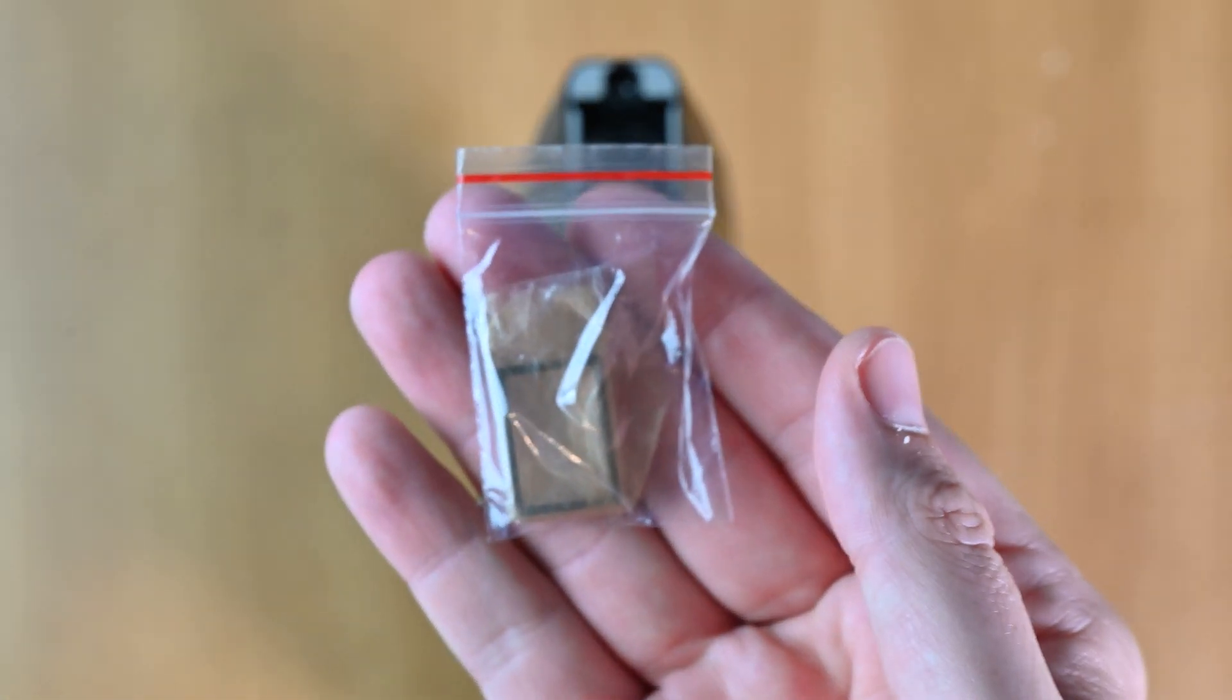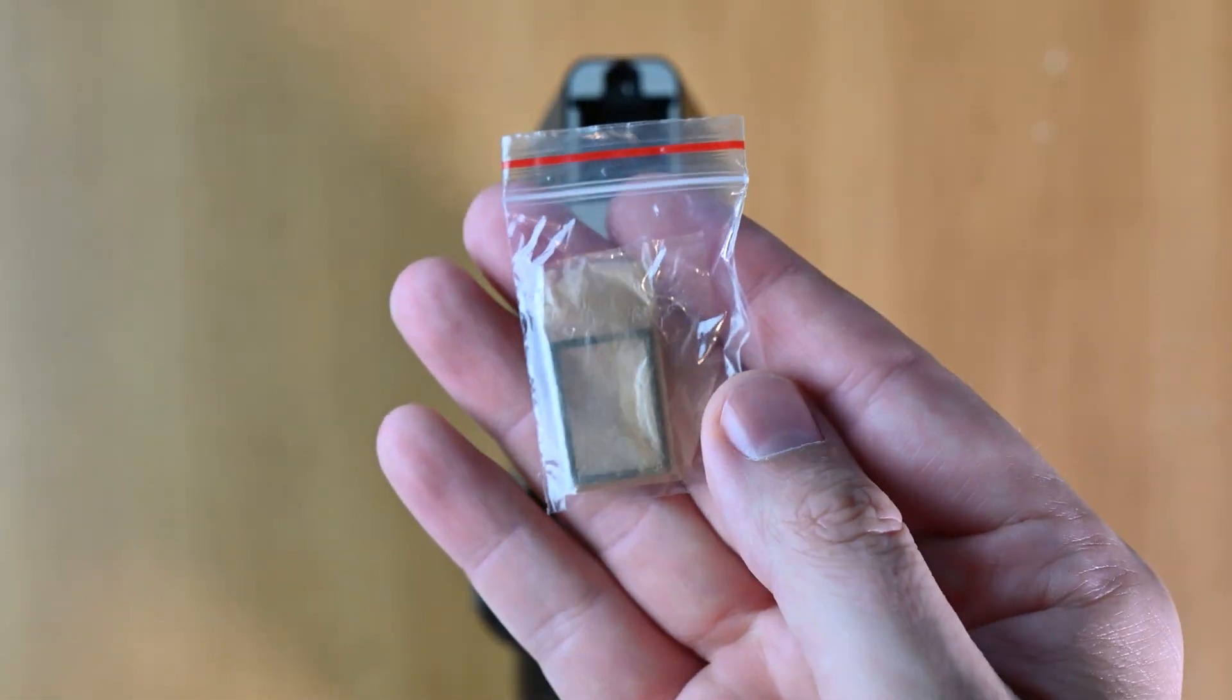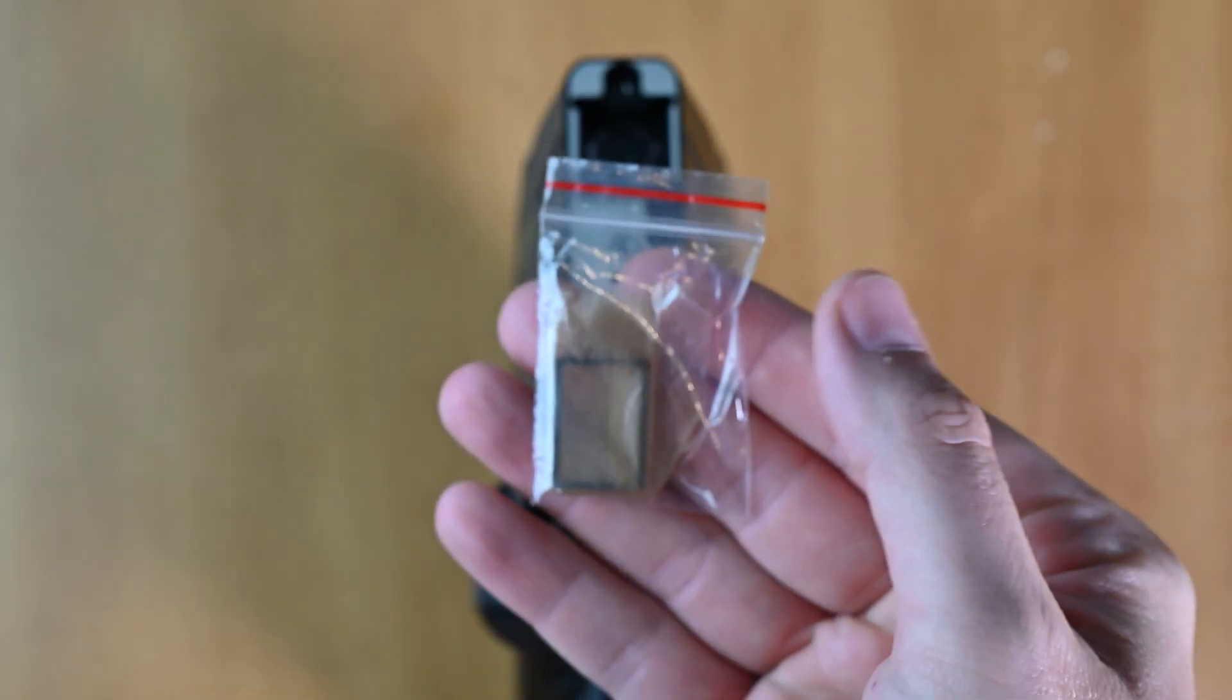The spares look like this. They're wrapped in kind of a papery material inside of a plastic bag that keeps them clean and protected.